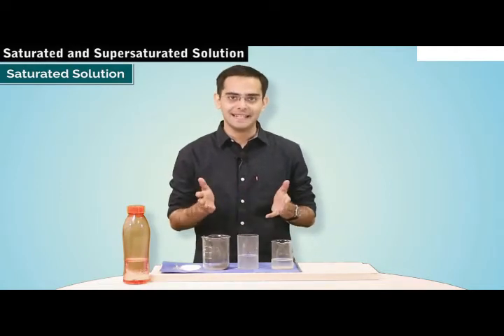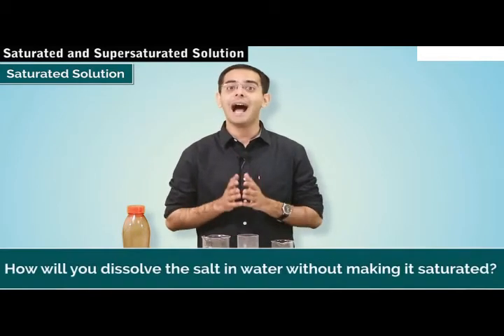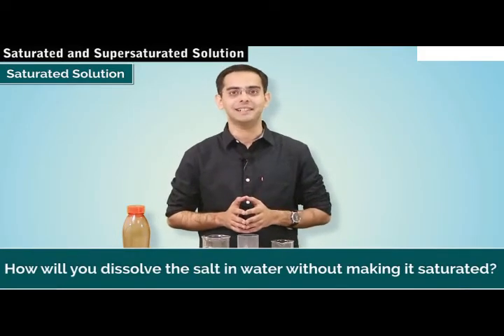And there you can see, now we have obtained the salt solution here. And what is the next method that we are going to apply? Yes, so we will evaporate the solution such that the salt will be separated from the sand mixture. So students, now my next question to you is, suppose you don't have sufficient quantity of water to dissolve all the salt in the mixture. Then how will you dissolve the salt in water without making it saturated?